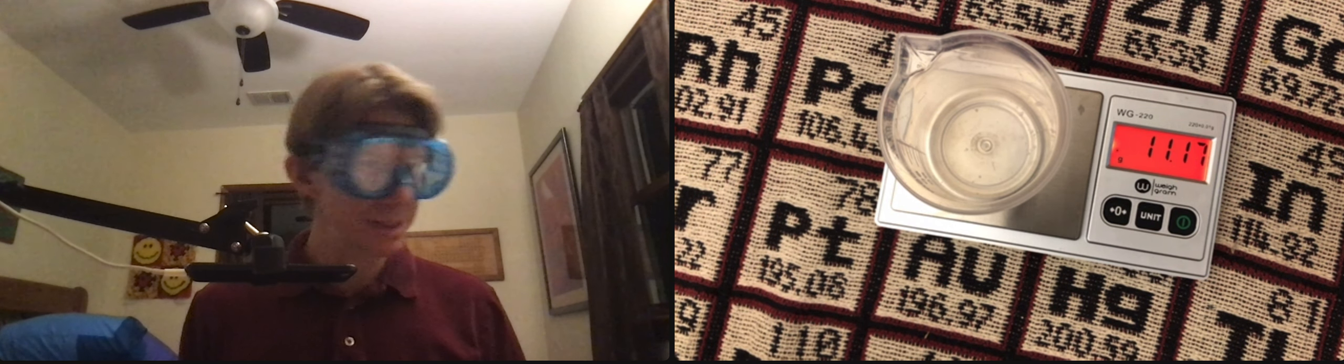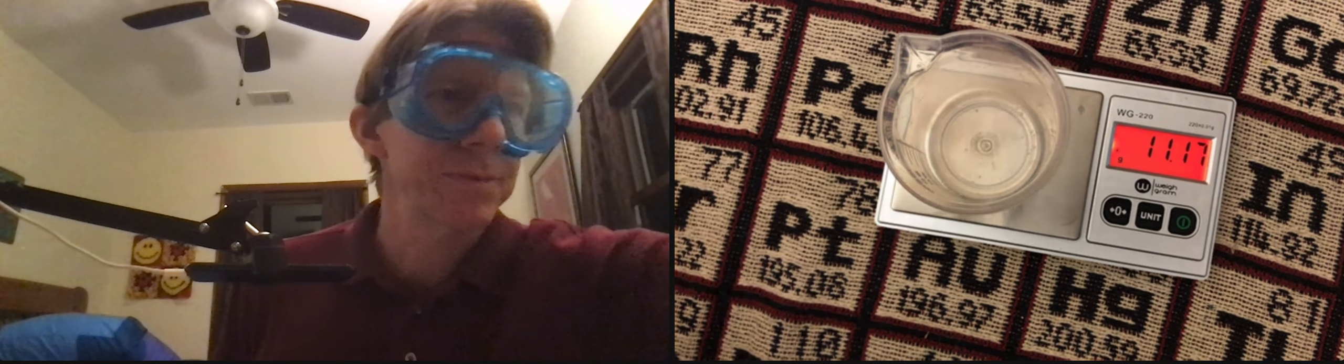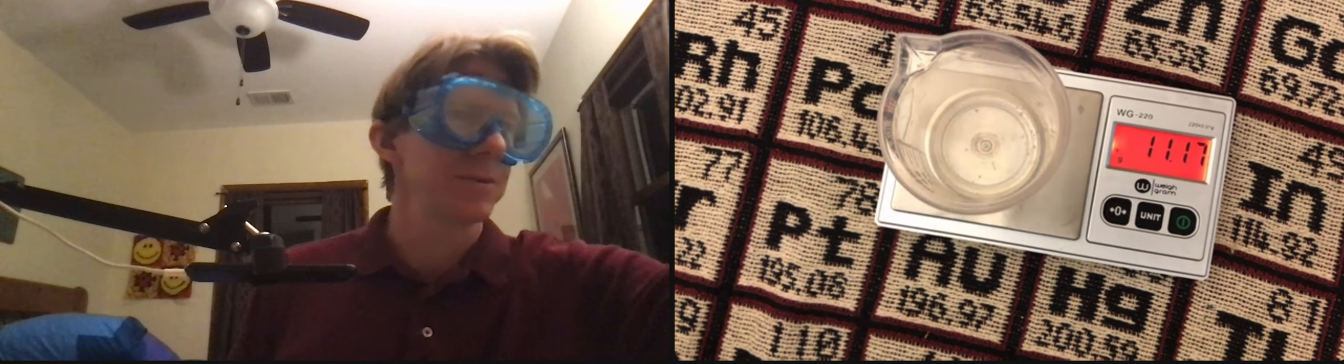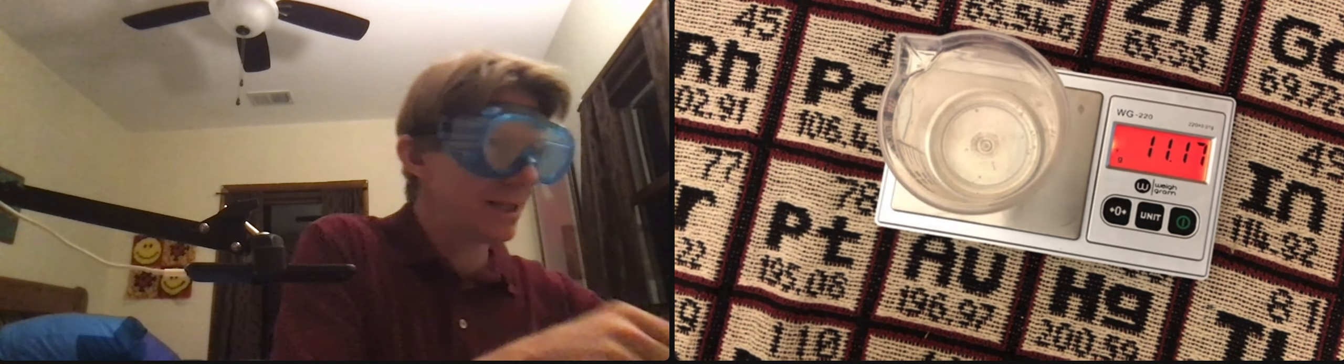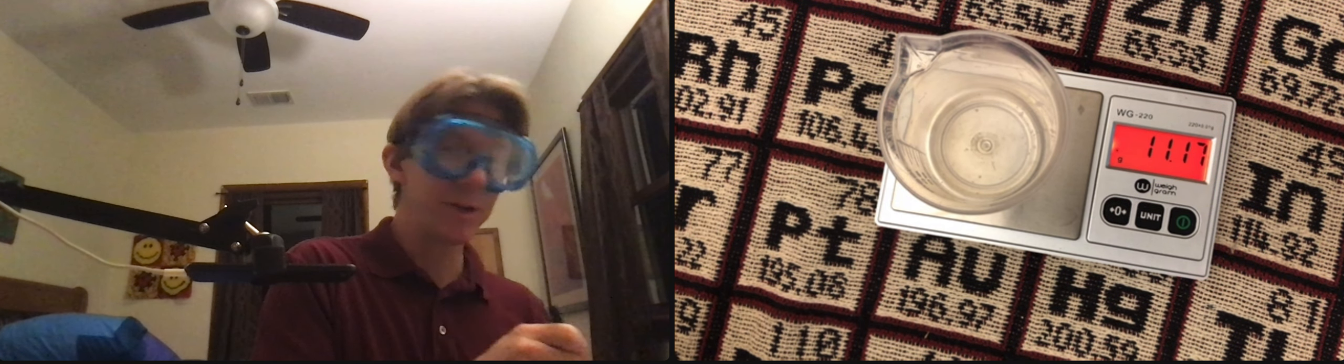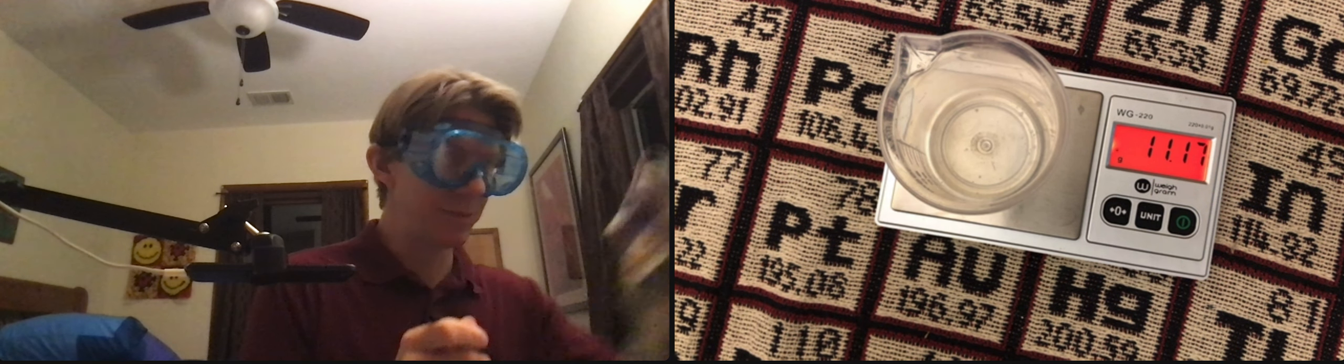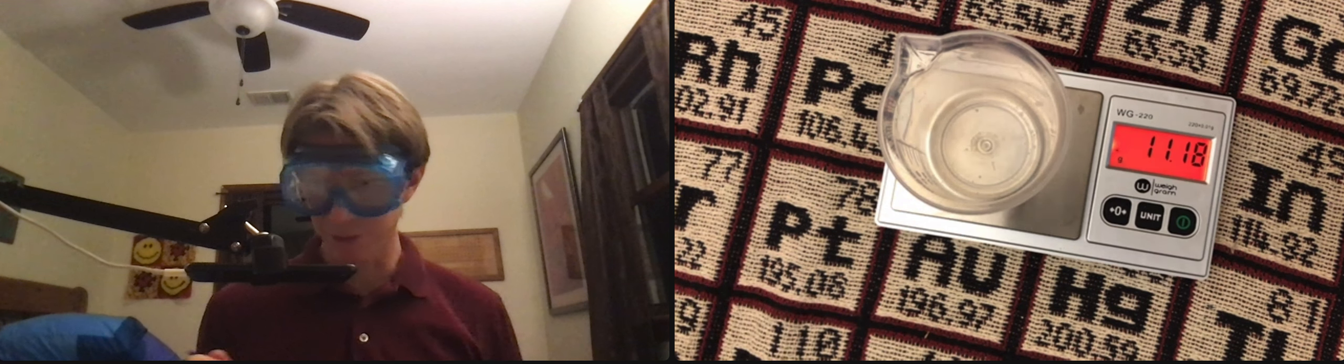And then I'm going to add my... well, here's something you should know. I've got my spoon and I'm going to clean it off very well because I was just mashing. So I'll wipe it five, six times or just get another spoon.